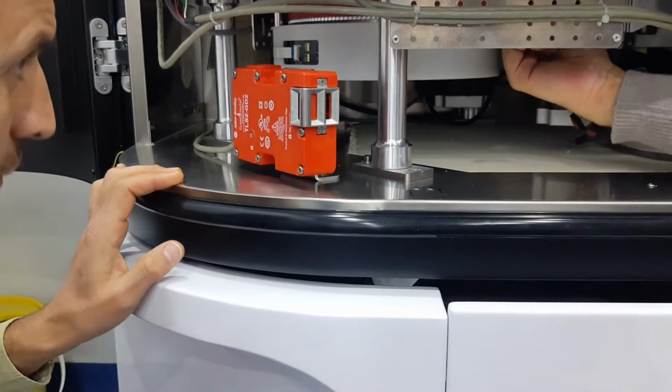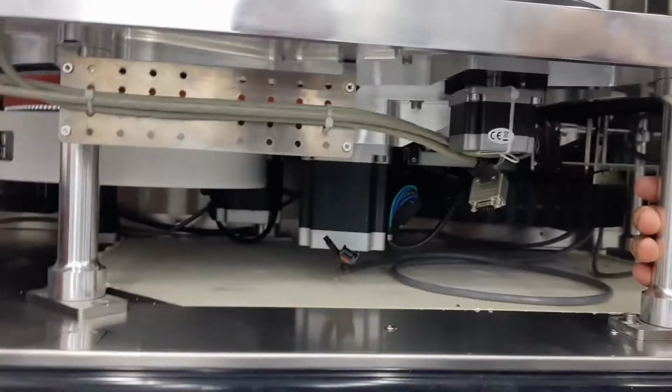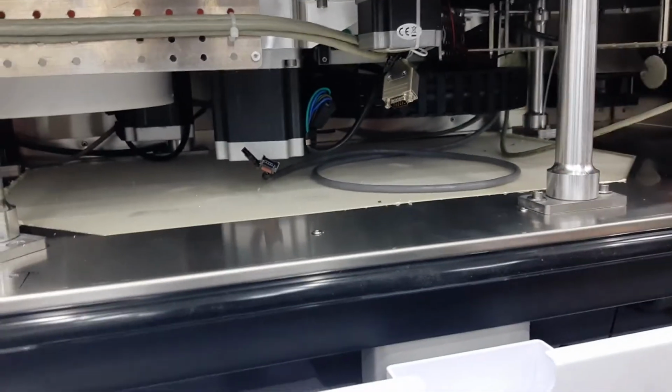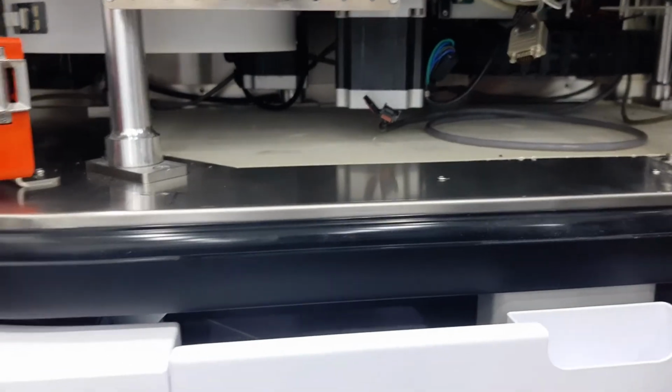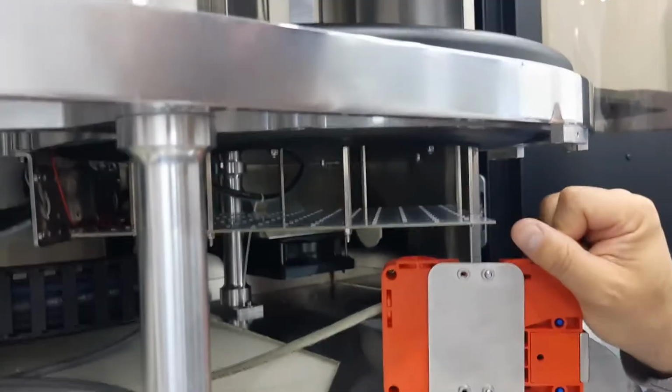Now the belts, we never changed one. So tension-wise, I think it's going to last. We did some calculation; they should last forever. So I don't think we need to change any of them. What's probable? Maybe if there's a problem, maybe one board to change sometime in a few years. What is this set for? Oh, this is the light actually. Light. Yeah.